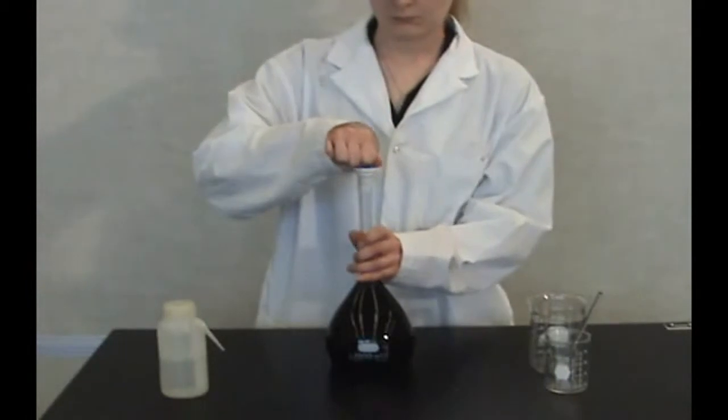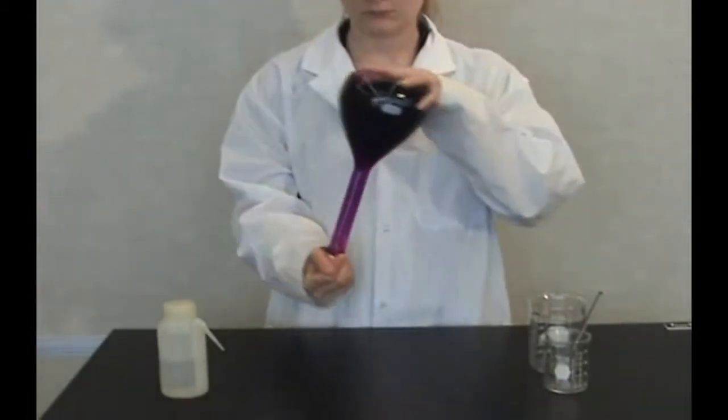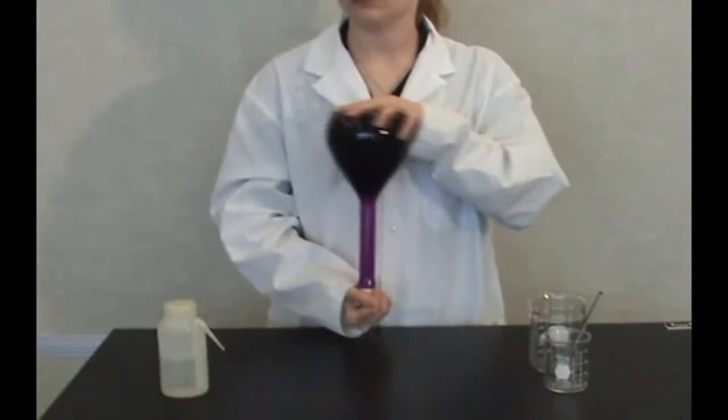Re-cork the flask, invert, and swirl. Do this at least 15 times to make sure that the solution is homogeneous throughout.